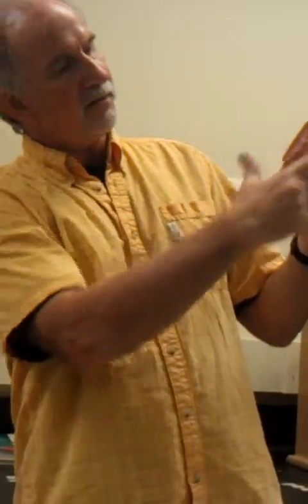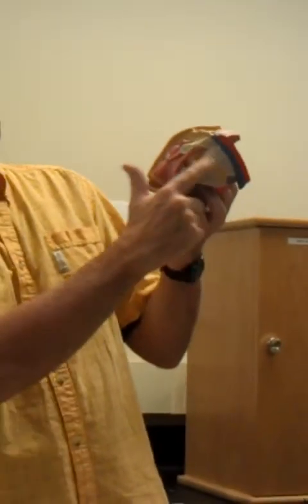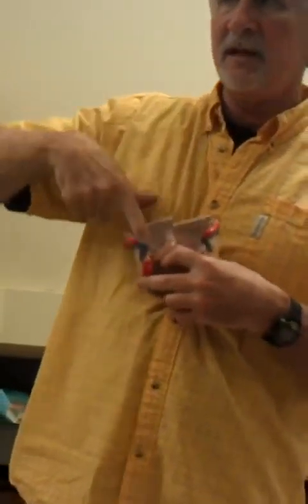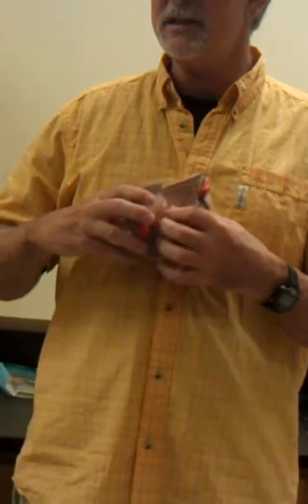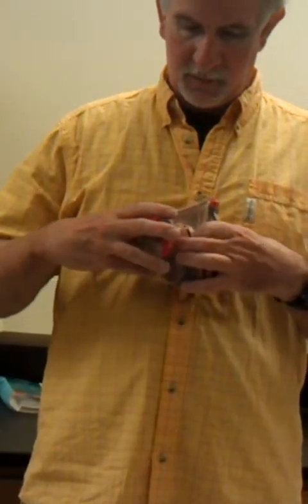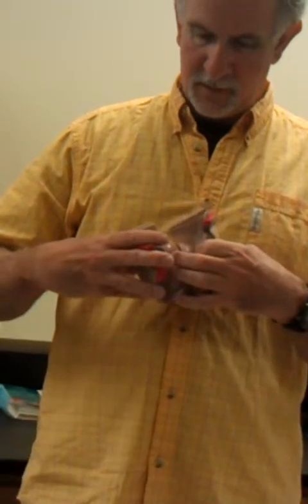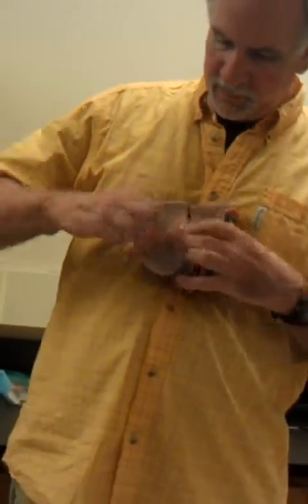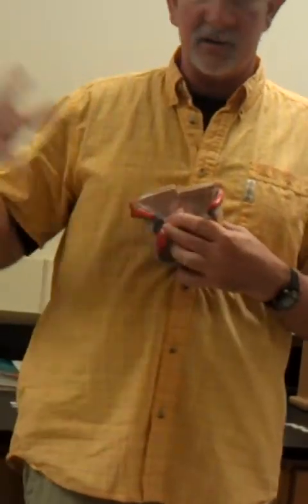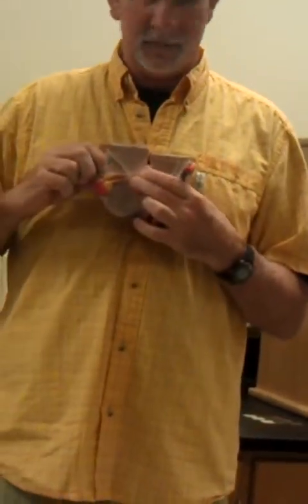There is a sheet of connective tissue that comes literally, see all this here? Everything I'm touching here, this entire sheet of connective tissue is called the broad ligament. You can see it in the pictures. Let's try and get this back together. This very broad, thin sheet of connective tissue that all this stuff is embedded in is called the broad ligament.